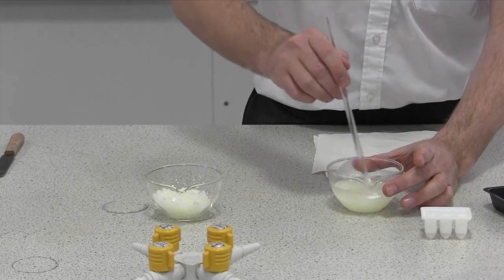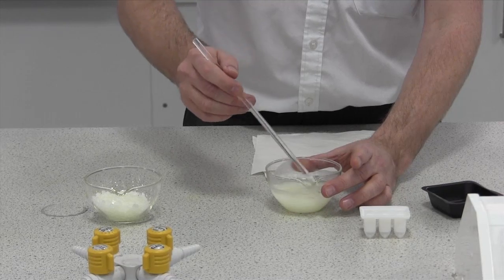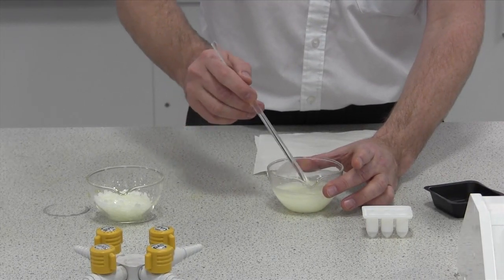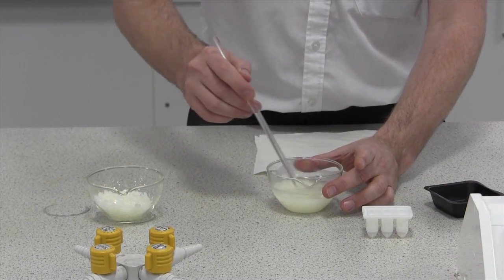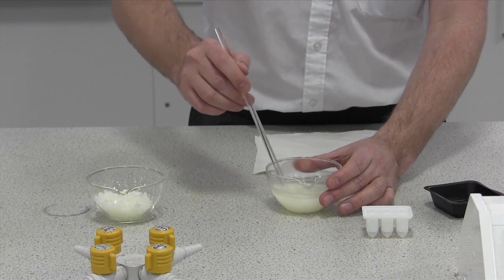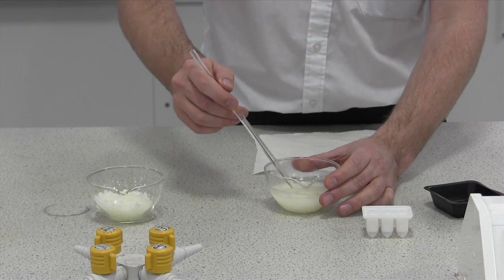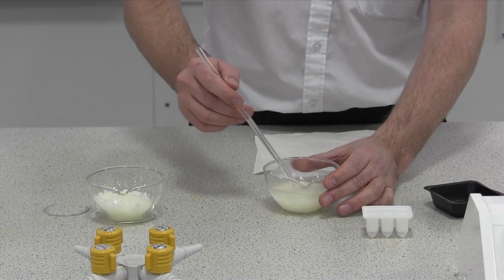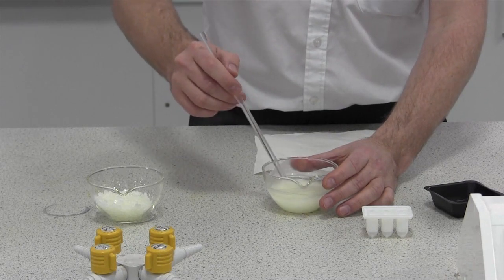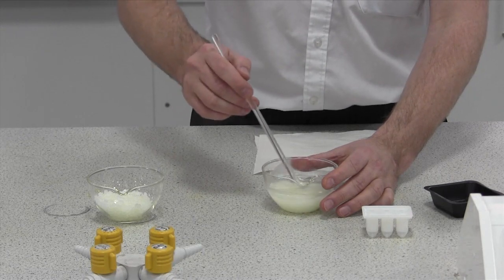Now, it's always gentle stirring. You can tell the colour of this liquid has now changed. It may take some time for it to completely go into the base, and you will need to keep stirring for a little while at least.